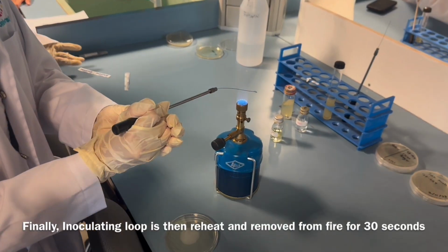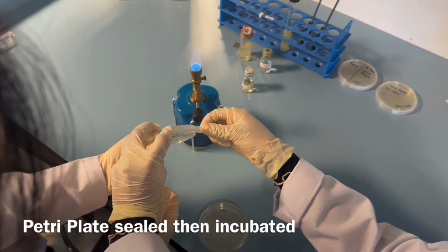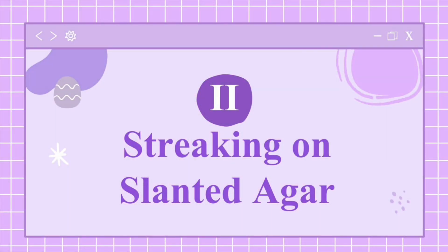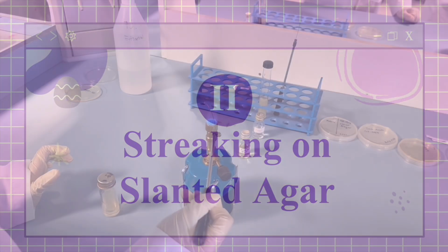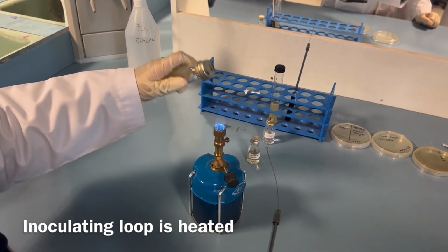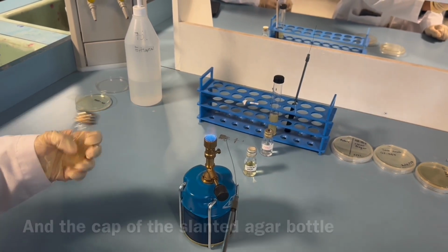And then to wrap everything up, the inoculating loop is reheated and removed from fire for 30 seconds. The Petri plate is sealed with parafilm. Moving on to streaking on slanted agar. The inoculating loop is heated, so is the cap of the bottle, to remove contamination.